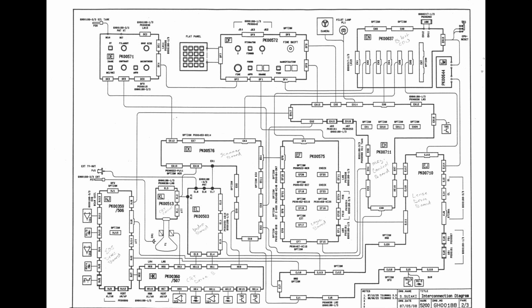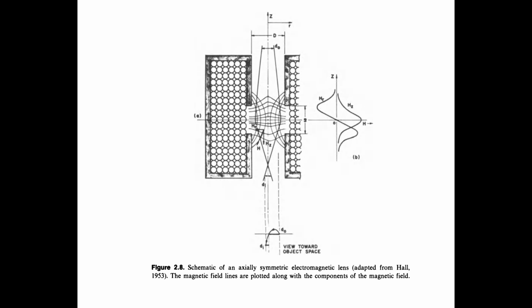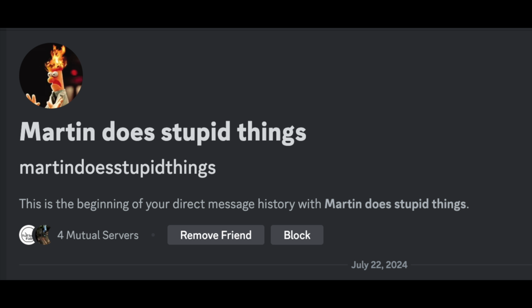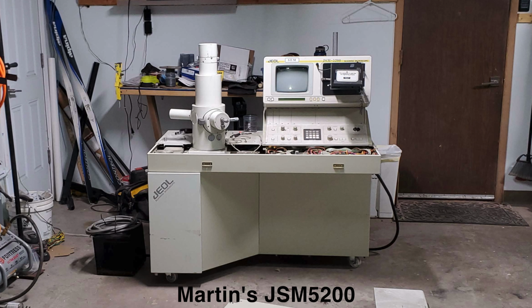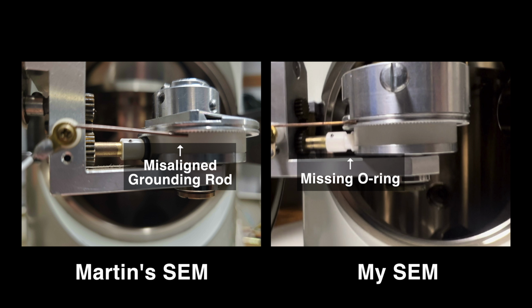It was then that I realized I was in over my head. I only knew the very basics of how a machine like this worked, and certainly not enough to repair one. To remedy that, I devoured information from books and online, quickly learning how these machines were built and how they worked. During that process, I managed to find this Discord channel of hobbyist SEM owners, and even found a couple of people, Martin and Monochroma, who were also fixing up their very own JSM 5200s. What incredible luck! I shared my manuals and schematics with them, and from then on, when something was not behaving correctly on one machine, we could leverage the other machines as a reference and more easily understand what needed to be fixed.